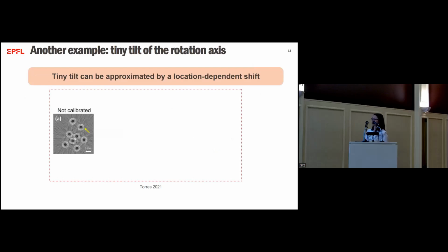Another example of mechanical artifacts is a tiny tilt of the rotation axis. A tiny tilt can be approximated by a location-dependent shift. And let's have a look at how it works.